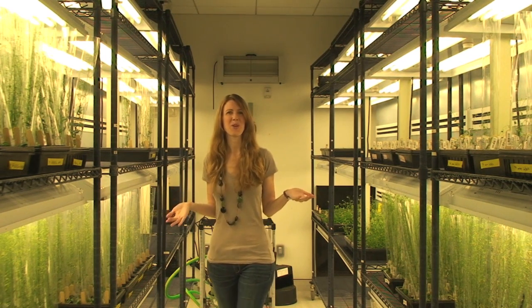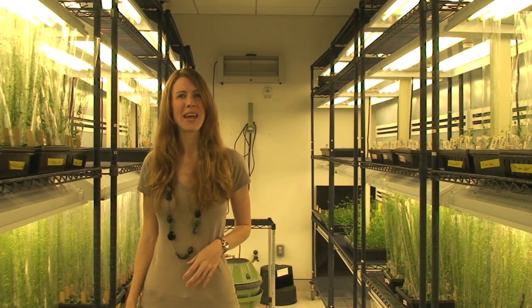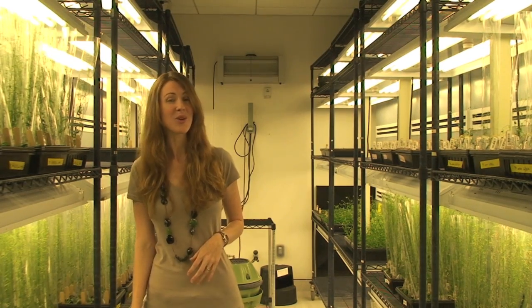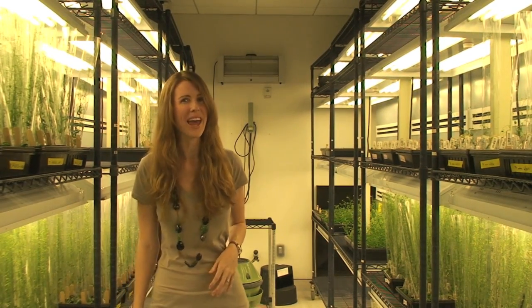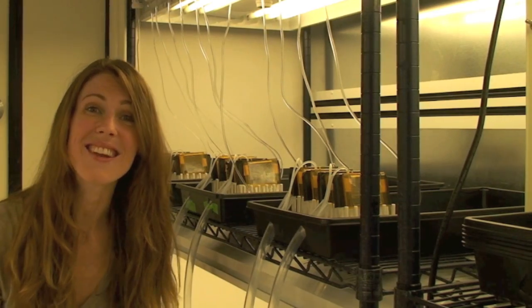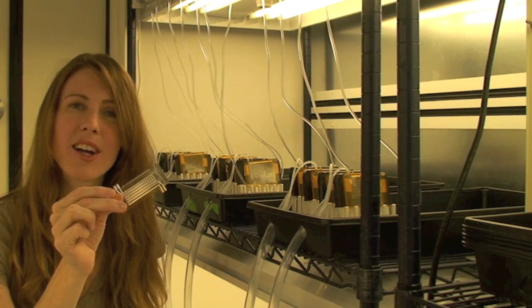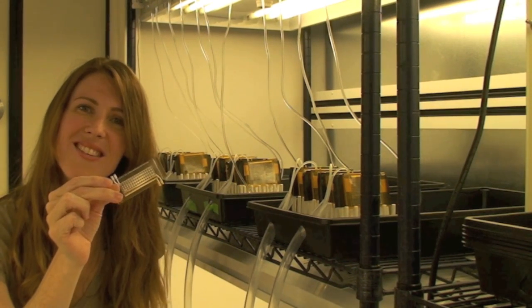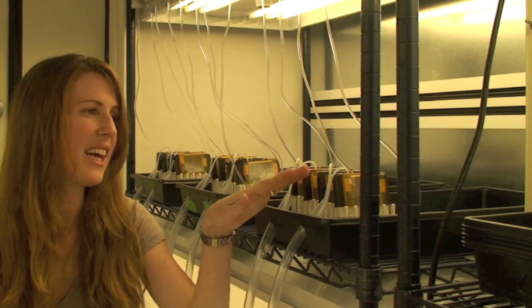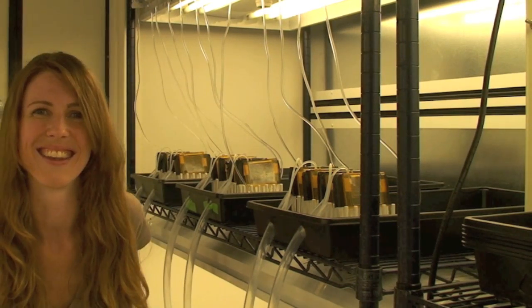This is a standard growth chamber, just like you have in your research lab. You can use this space to grow seedlings to adult stage plants. Or you can use this space to house your RootArray. Not so much space is needed to house your RootArray. The platform's quite small. This chamber can grow 64 seedlings at once. We also have a module in which you can grow 128. Here you can see we have 12 experiments running simultaneously.